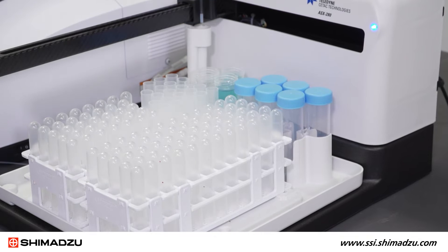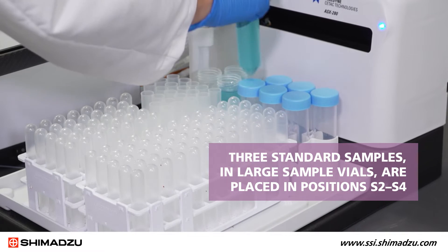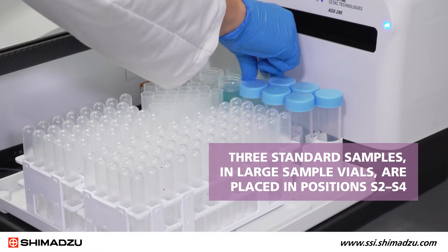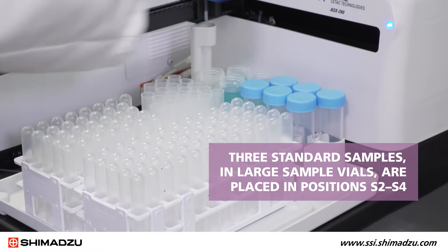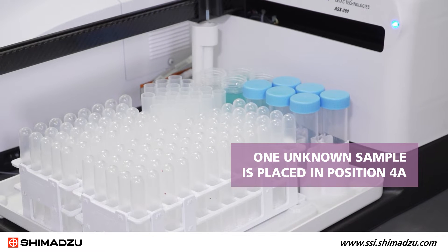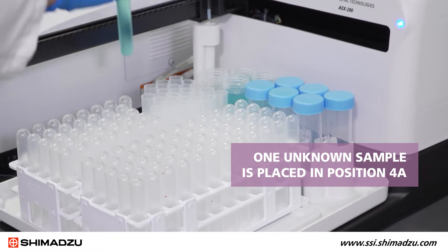In this demonstration, three standard samples in large sample vials are placed in positions S2 to S4. One unknown sample is placed in position 4A.